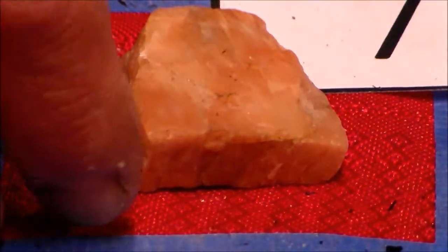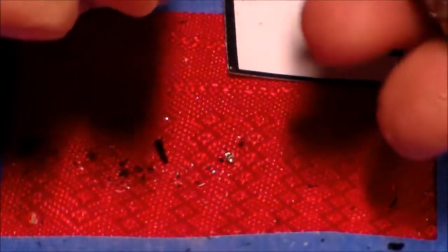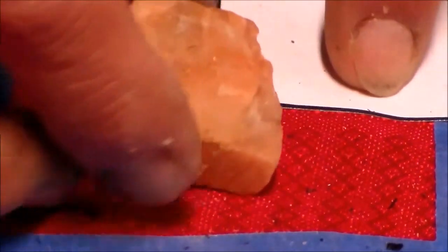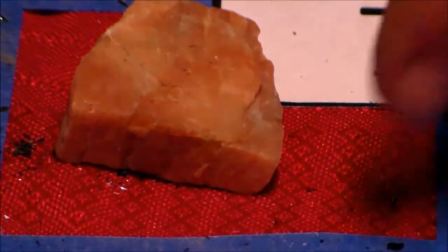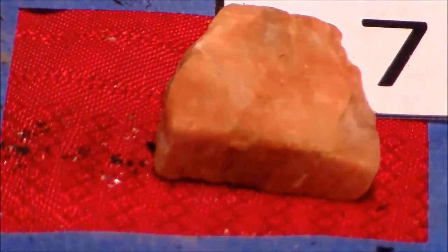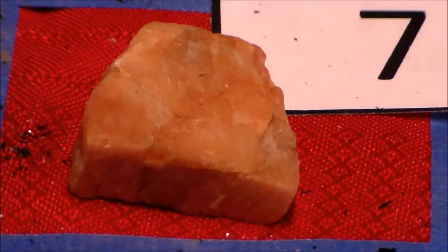Let's check out that specific gravity again. Try and find a sample that's a fairly similar size. It's very light compared to one of our metallic ones. So we know that the specific gravity is pretty low. We also know we've got a flat plane this way, another flat plane this way. So you've got some 90-degree angles going on here. Probably two 90-degree angles. If you look at the color, it's kind of a pink salmon color. So hopefully that's enough information for you to get sample number 7.